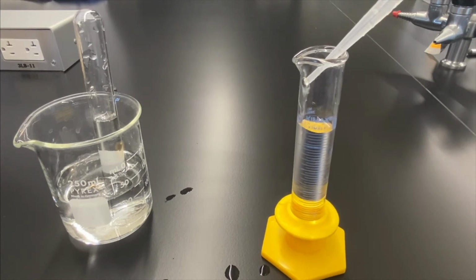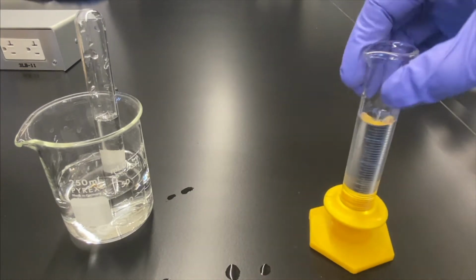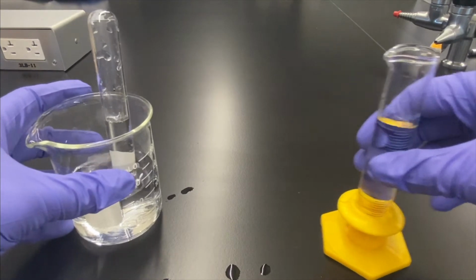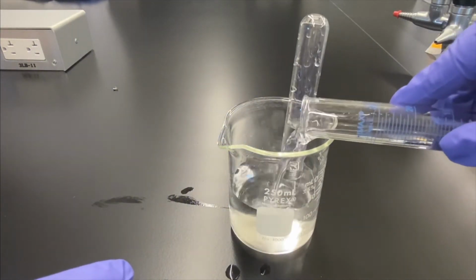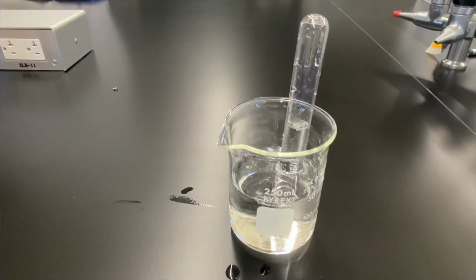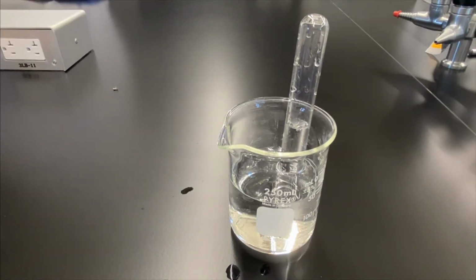So hopefully you remember from class what happens when you add pure metals to HCl. What do you form? Something to think about. And as you can see here, we're adding acid to water. That's the way to do it. That's the way you're supposed to do it in the lab. And if you want to remember, you can say, do as you oughta, add acid to water.